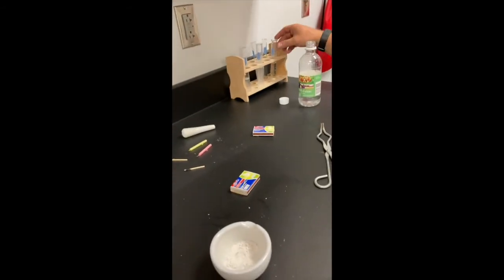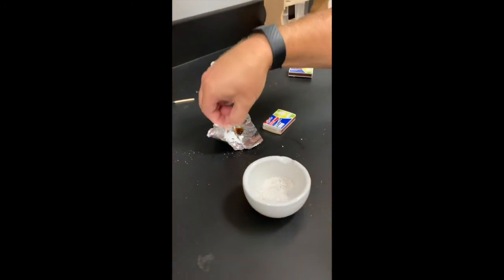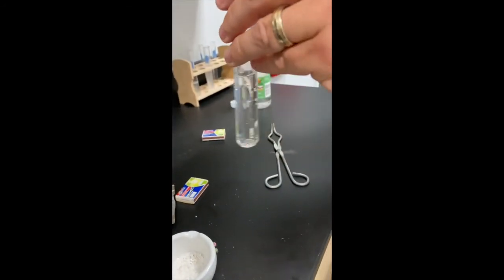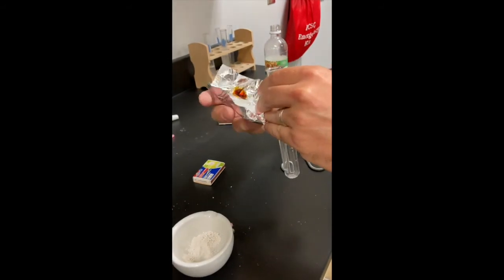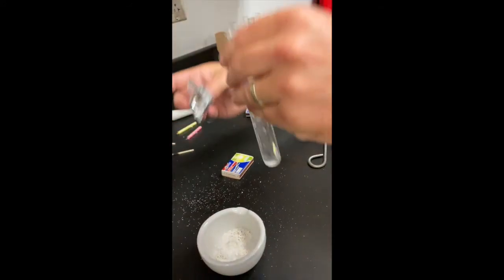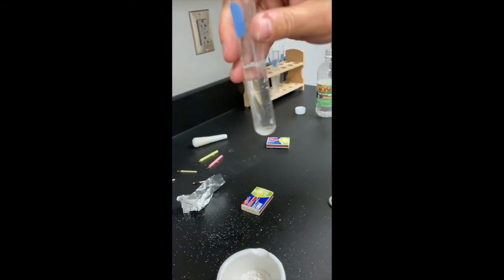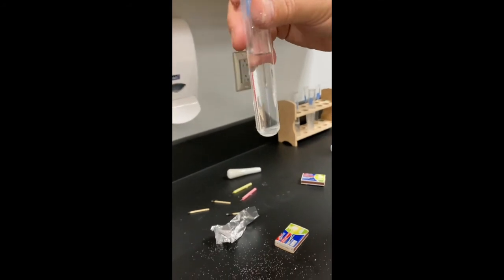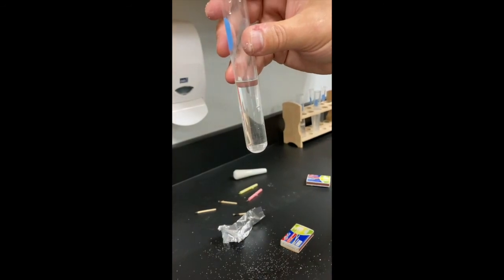Now, I also have some water here, and I'm going to pour some sugar that didn't get heated on this, and I got a little bit. But I'm going to sprinkle it in there. Missed completely. I pour the sugar into the water and shake it. And again, the question is physical or chemical change and why.